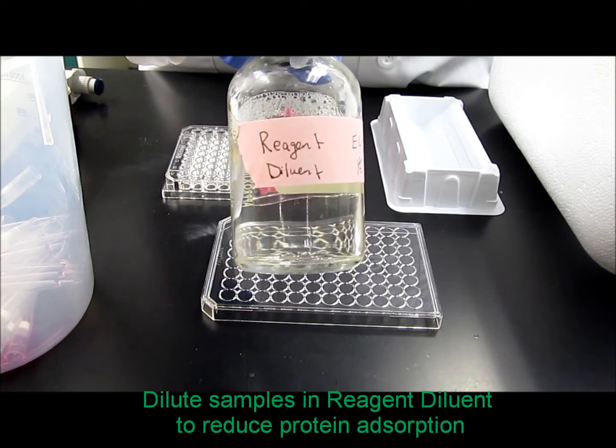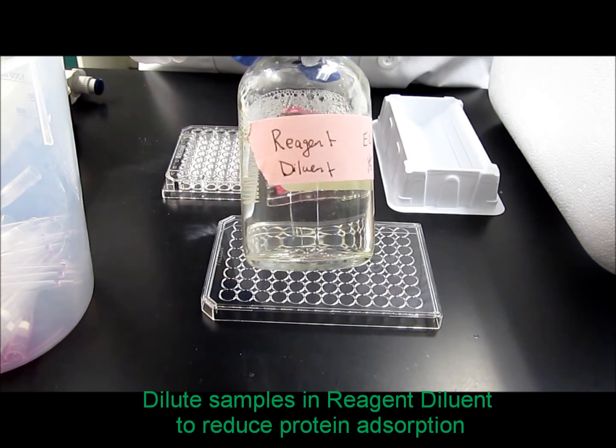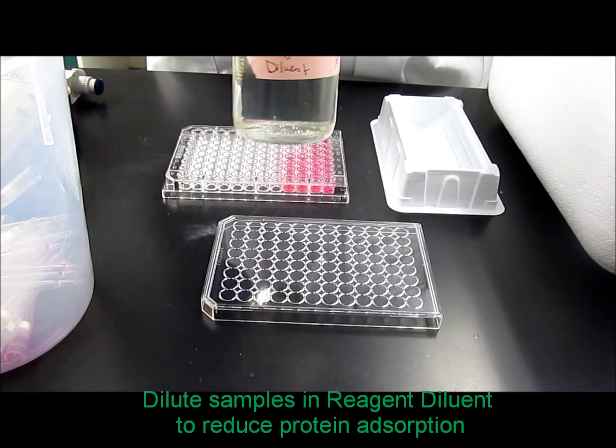Be sure to dilute samples in reagent dilutant instead of water or PBS, in order to reduce protein adsorption.